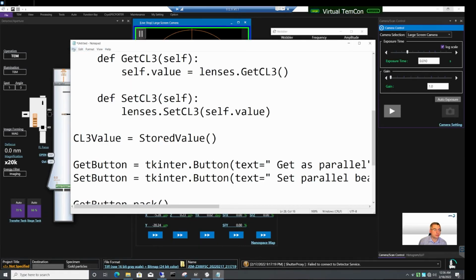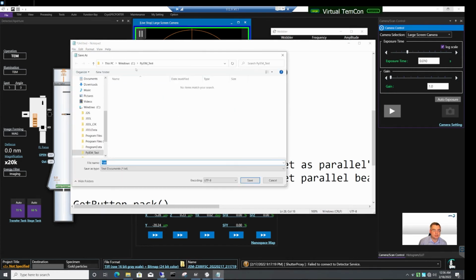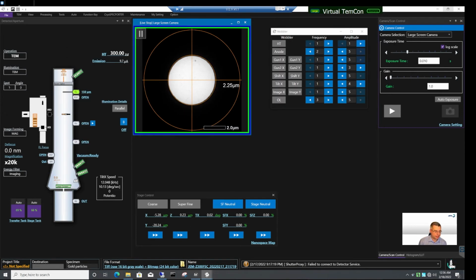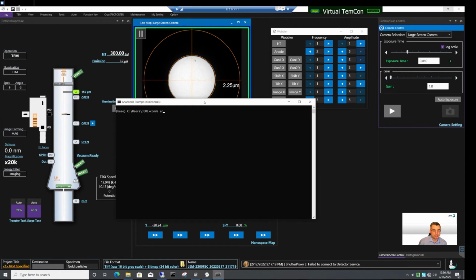Now let's make sure that this works. Let's save this, and let's save this first as a text file, test.txt. And then let's try to execute it. So I need Anaconda prompt for that, and I need to activate my PyJEM environment. Then I need to navigate to the directory where I saved my file. This is PyJEM test, and I need to rename my test.txt to test.py. Okay, and then I have to run the script just by typing python test.py.